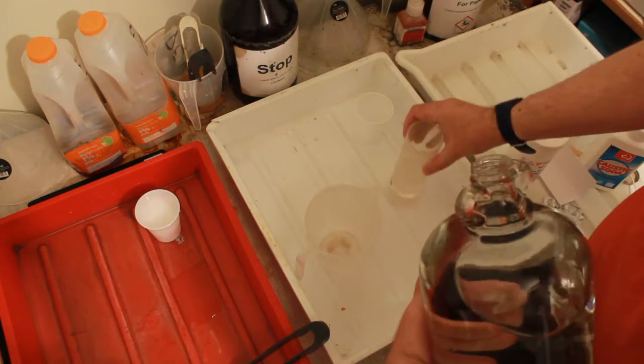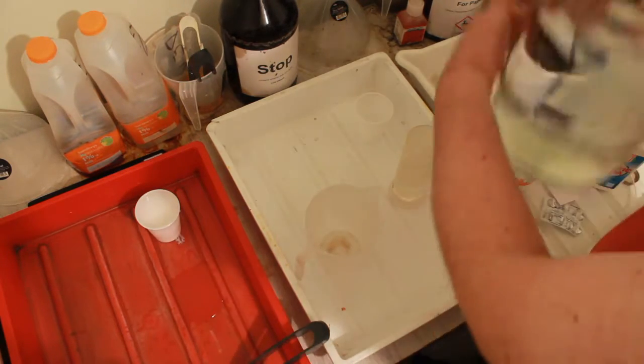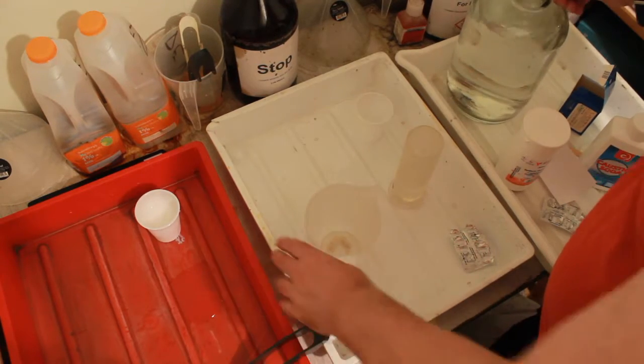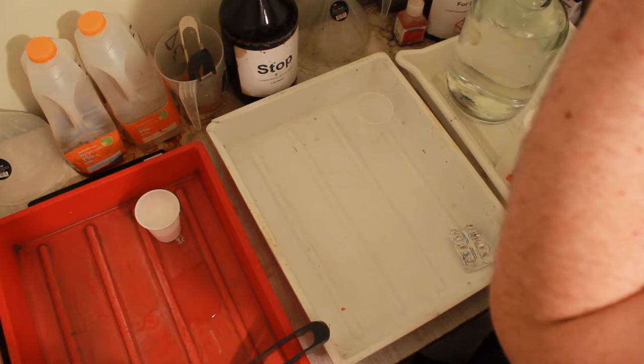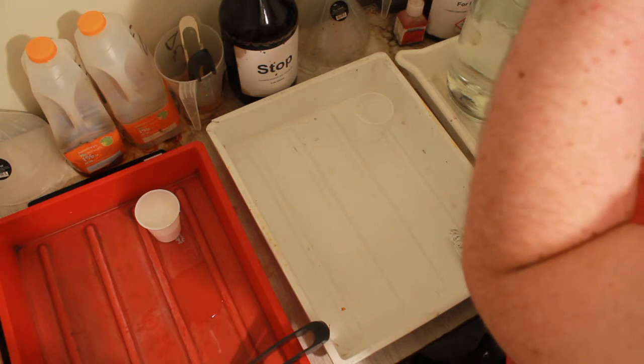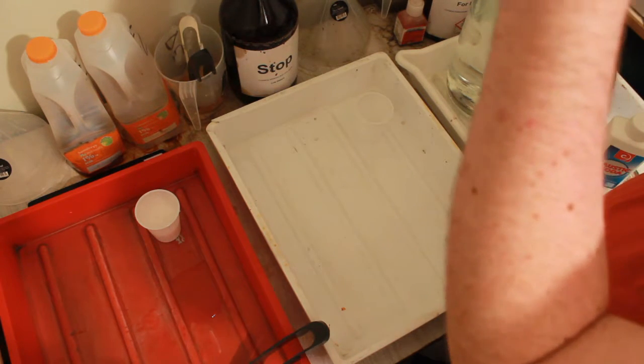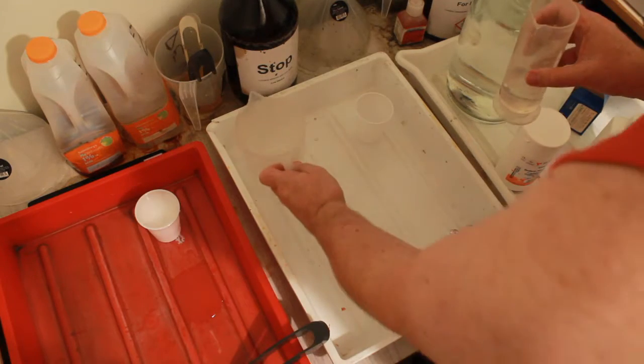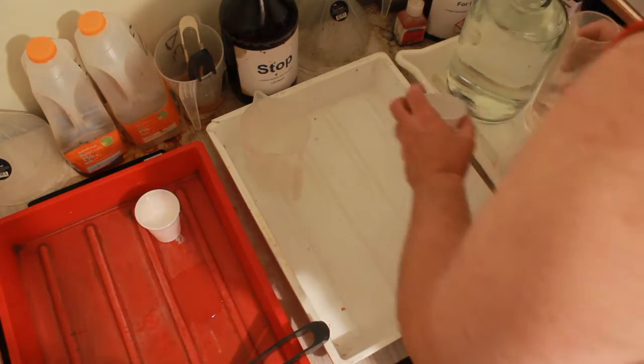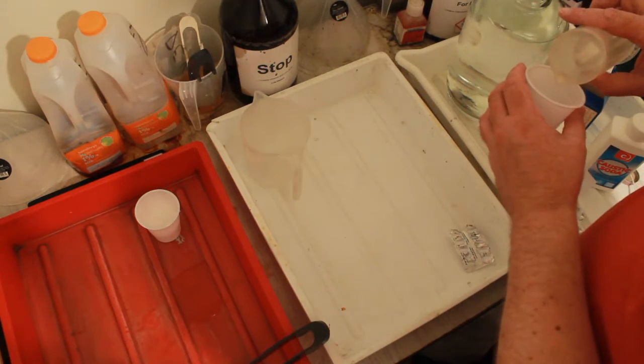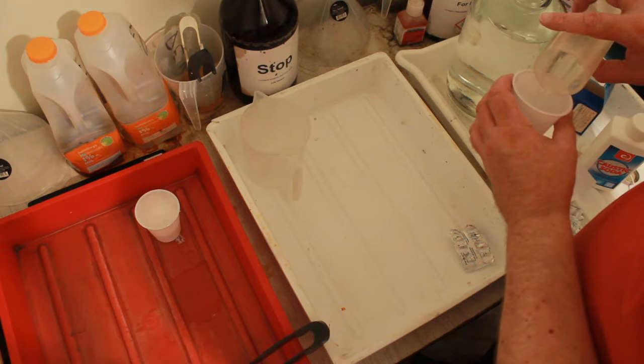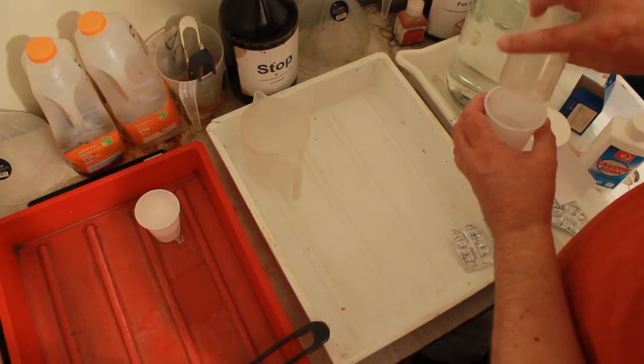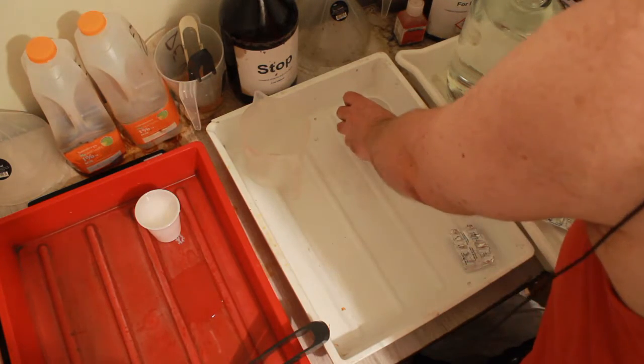Look, that's way over. I can put that in this one. There we go, 75ml. Yes, this is the safest way of doing it. That water should be fairly cool.